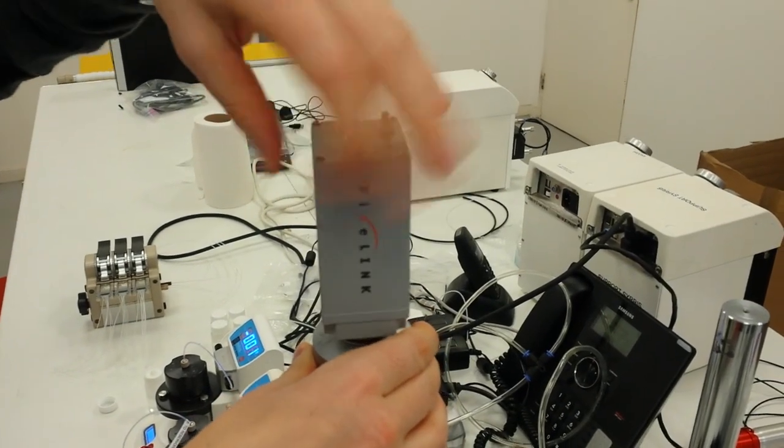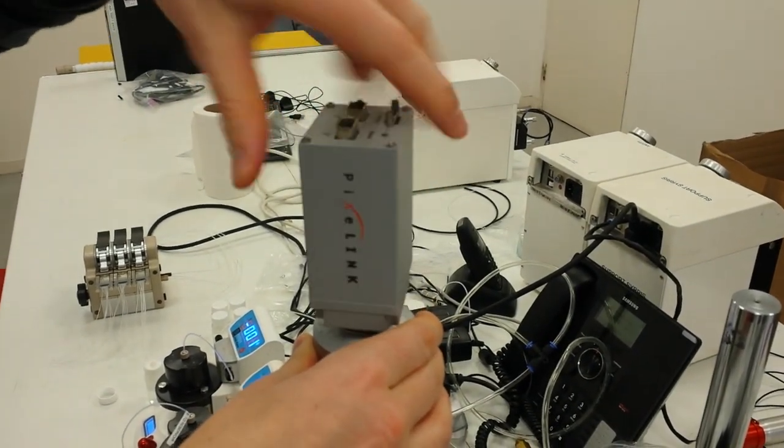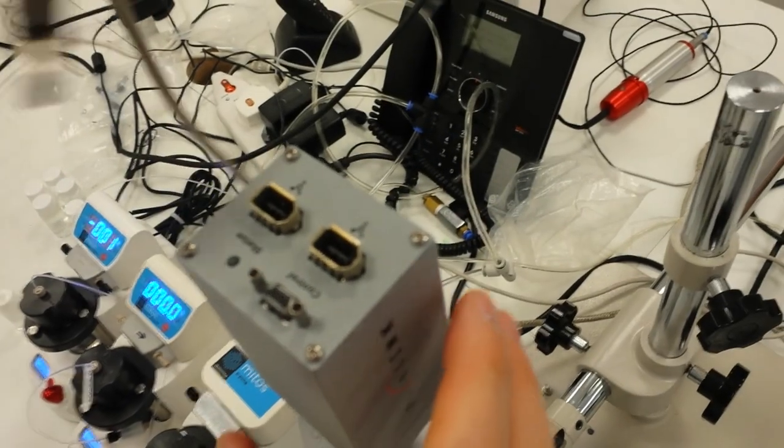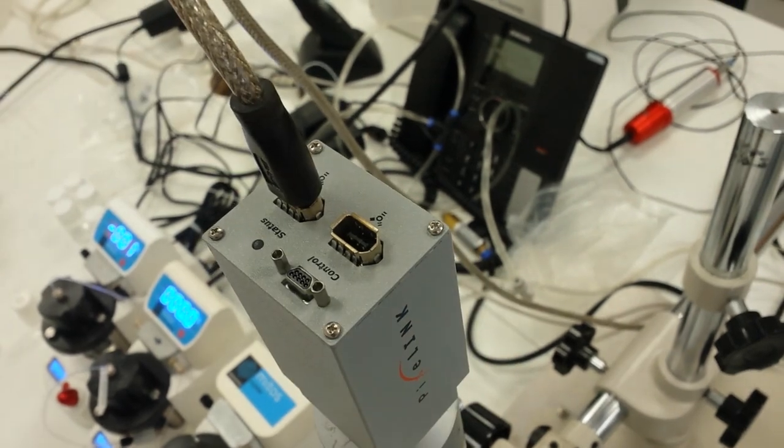We're kind of good to go. I think these microscopes these days are very generic in terms of their fittings. That's just showing how we take it off and put it back on again. Thanks very much.